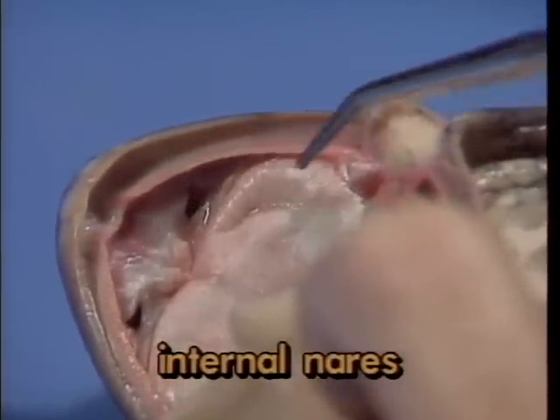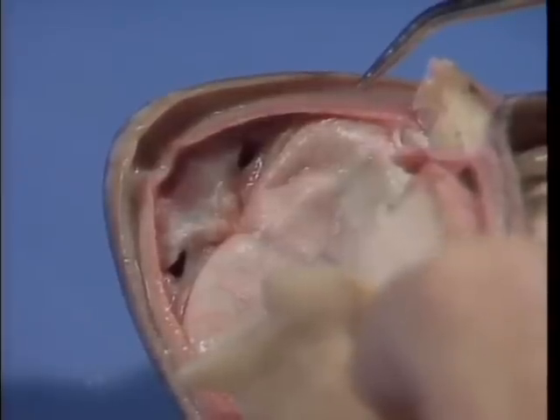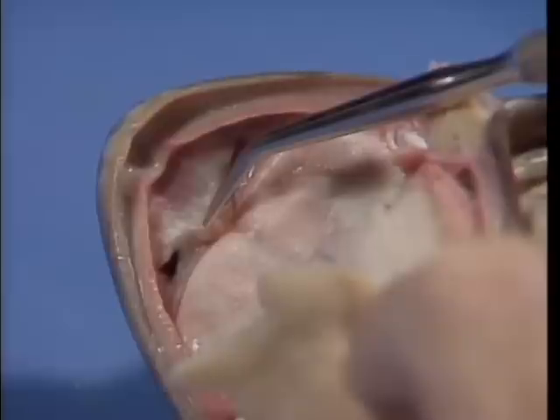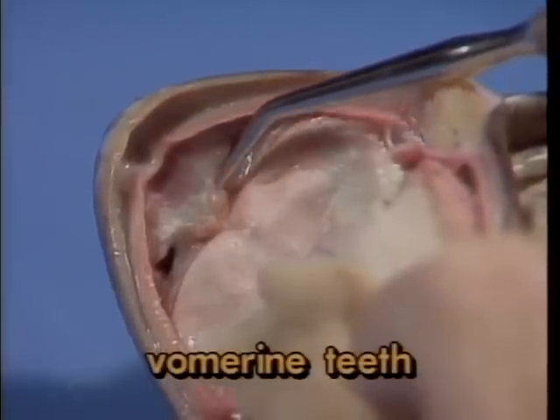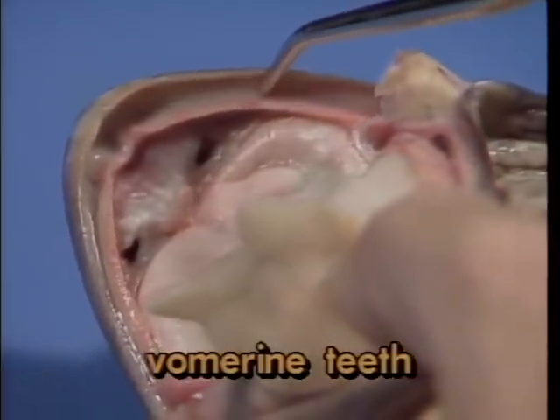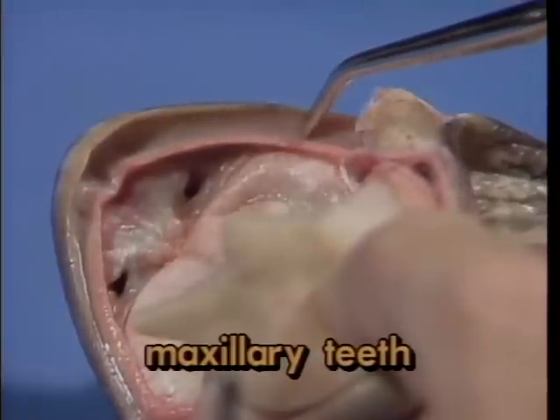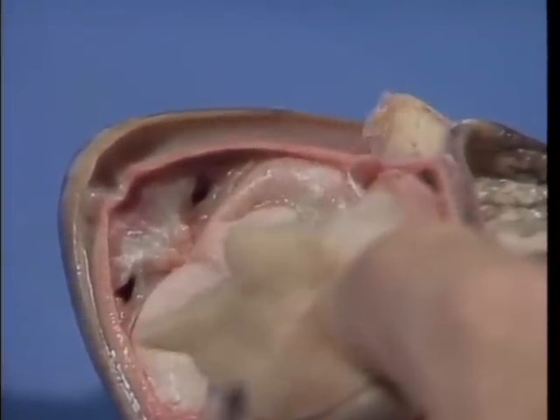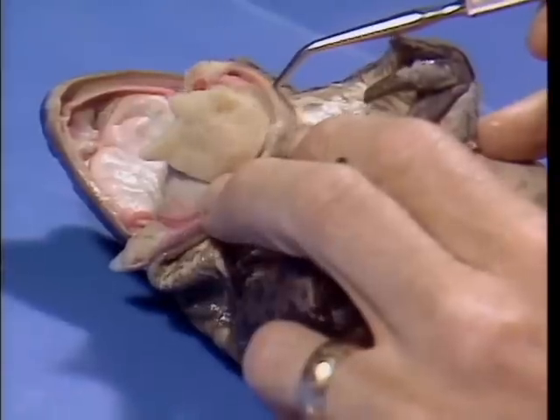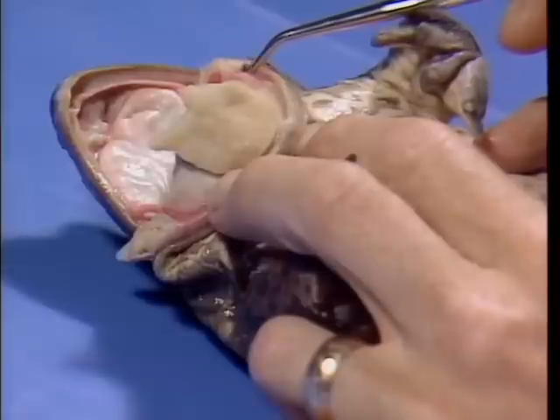Air from the external nares enters the mouth cavity through these two openings in the roof of the mouth. Located medial to the internal nares are the vomerine teeth. Much smaller teeth are found along the margins of the upper jaw. These are the maxillary teeth. Note that, as is the case in most species of frogs, there are no teeth along the margin of the lower jaw. Teeth are useful only in holding prey, since frogs do not chew their food.